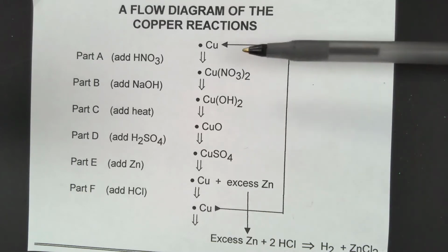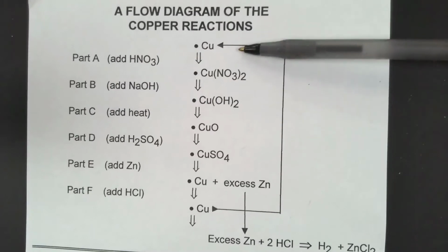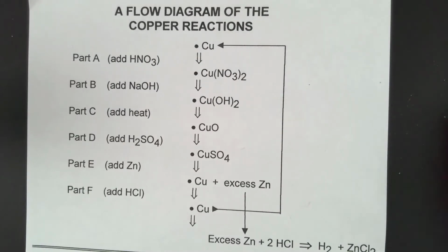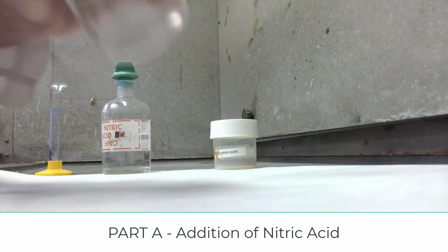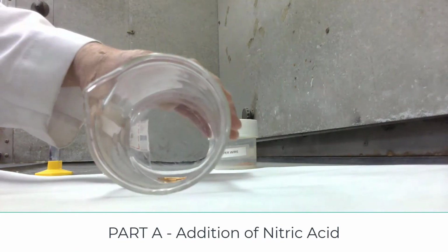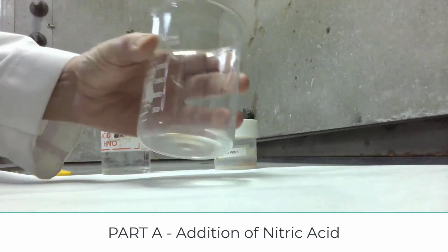So to do this part, we have to go to the fume hood, and I have to weigh out some copper. So first of all, I'll weigh out some copper. In the beaker, I put my weighed copper. I don't know if you can see that well or not, but that's the copper weighed out.